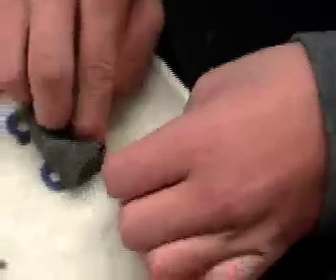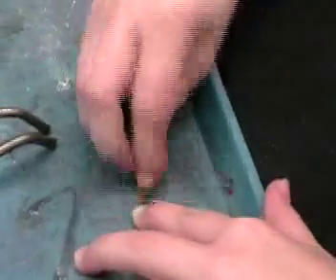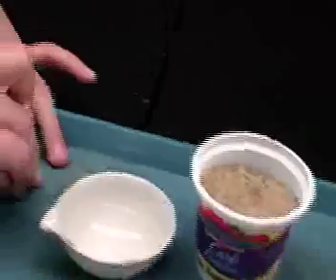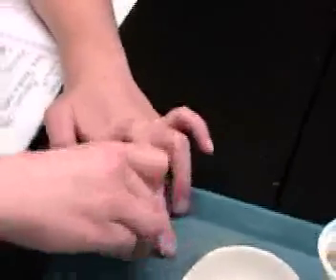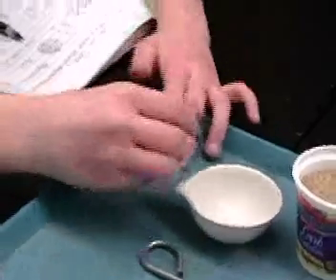We broke it. You're absolutely going to need to do something with those sleeves. I think I've got one little part of it. Once you start seeing some silver, it's good enough. If you've got enough to make your observations, then you've got enough to react it. But it won't react if there's too much black.